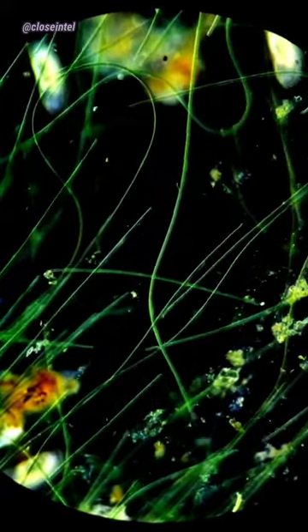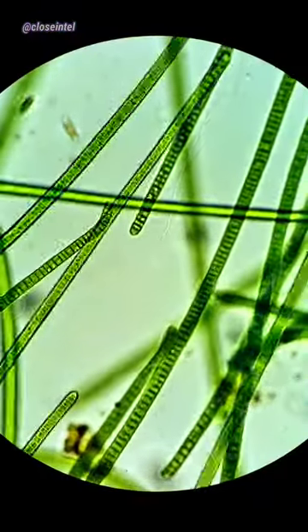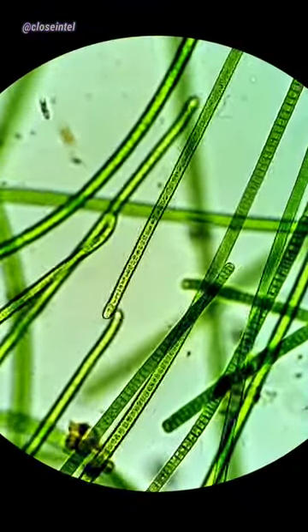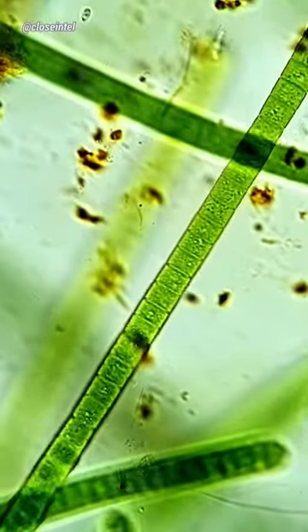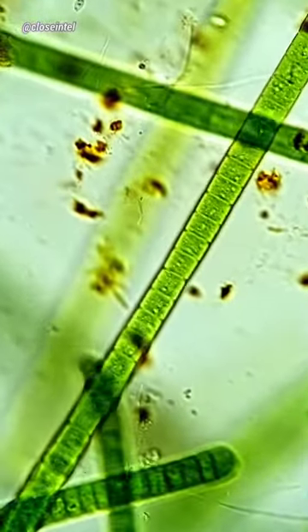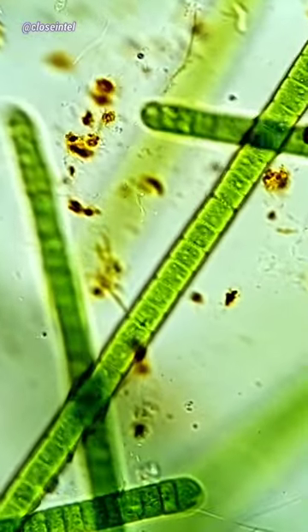They move by gliding across the surface using protein fibrils and other organelle-like structures which secrete a slimy fluid acting as a propellant. Cyanobacteria is also one of the many reasons you're even here right now, as they play a huge role in helping to create and sustain the oxygen in our atmosphere.